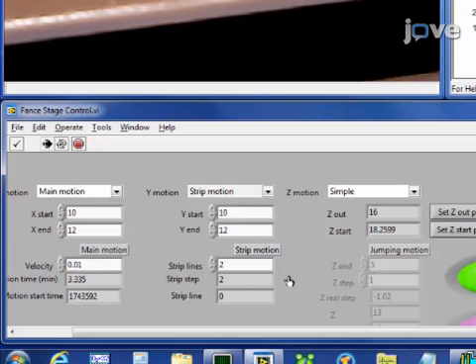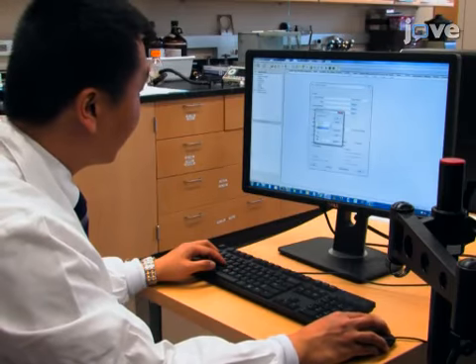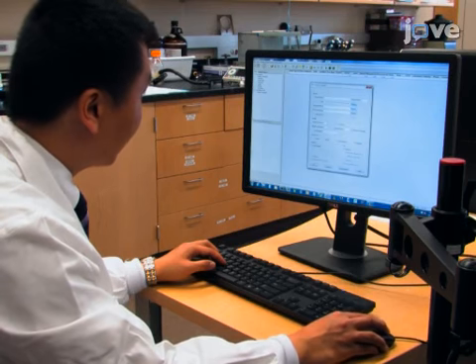between lines. Set up a method for the automated acquisition of MS spectra from the mass spectrometer.